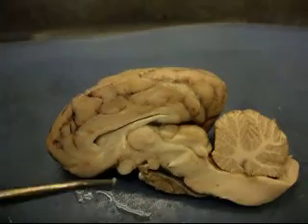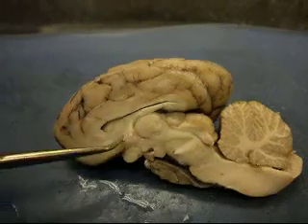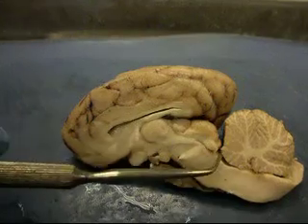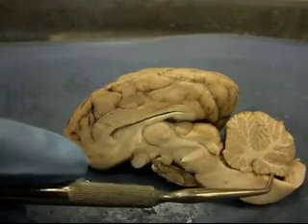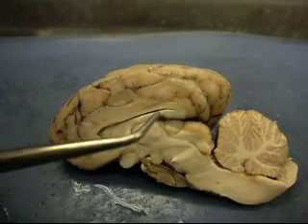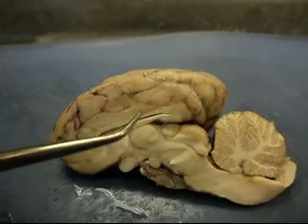I think that's the end of our demonstration. I need to correct a few things from our last video: this face right here is the lateral ventricle, not the left ventricle — I got that wrong. This is the fourth ventricle. And that ends our demonstration.